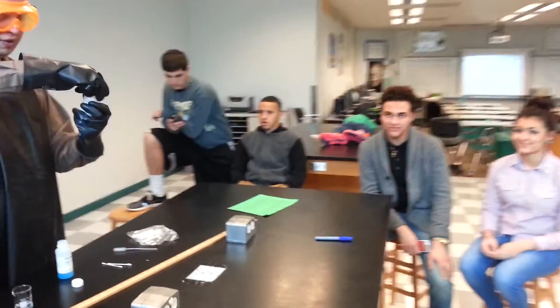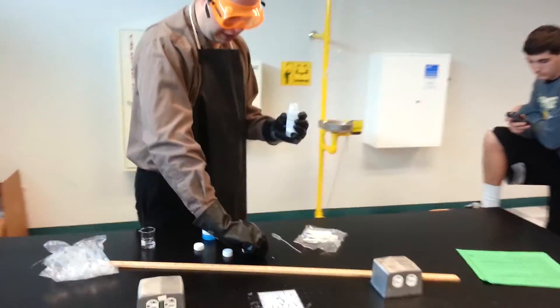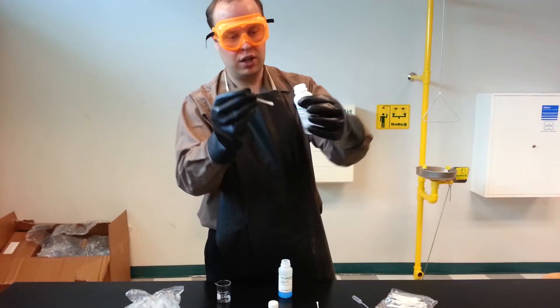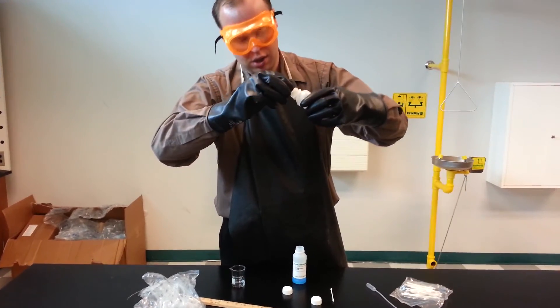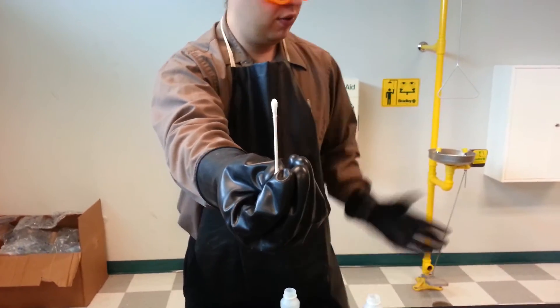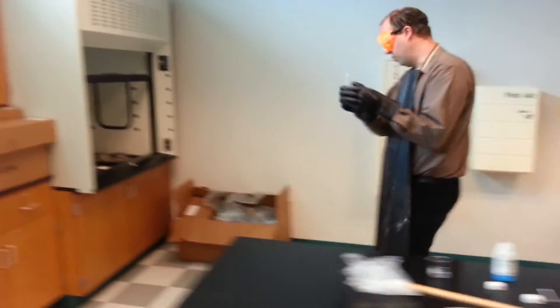Let's do it again with lead nitrate. Again, remember lead nitrate is a pretty clear liquid. Q-tip. Looks like it's just wet. Put them over here and do the sulfuric test.